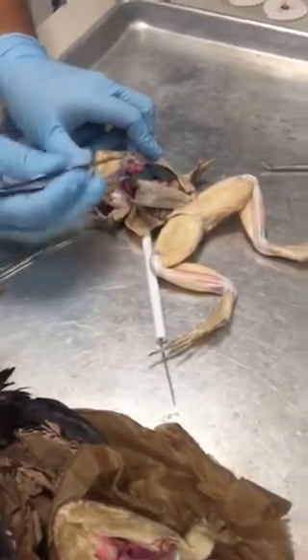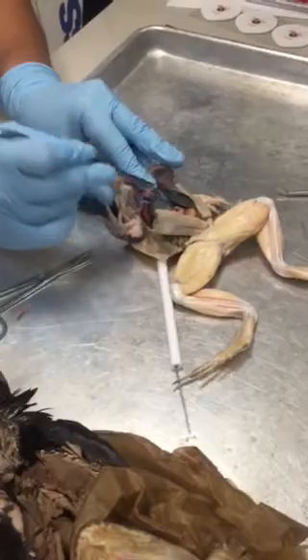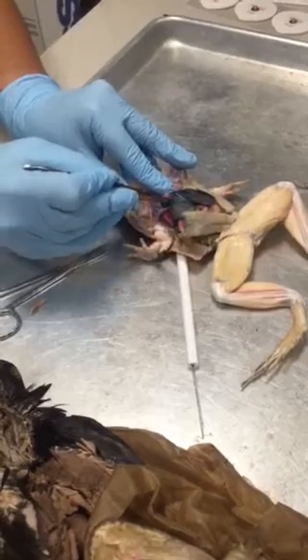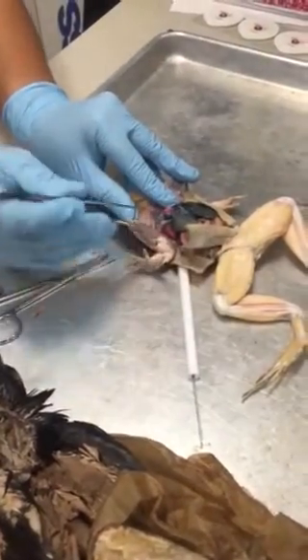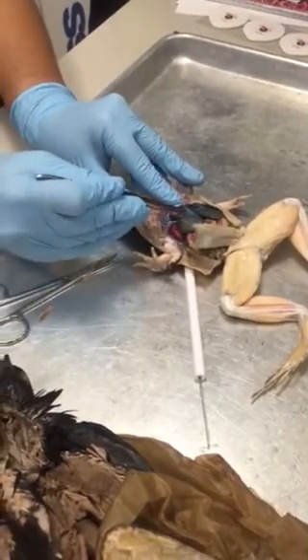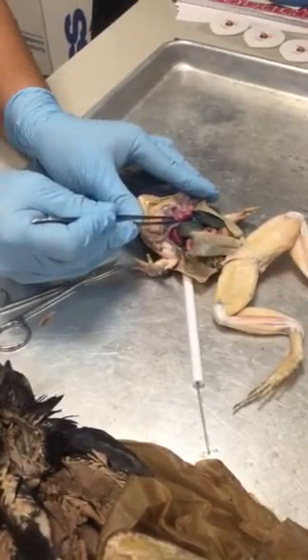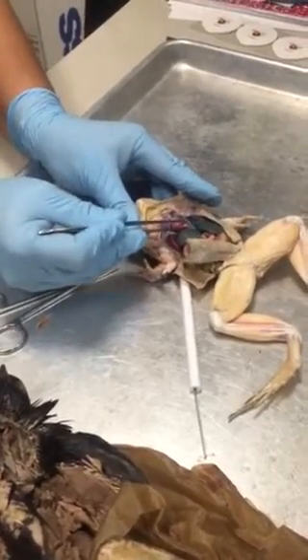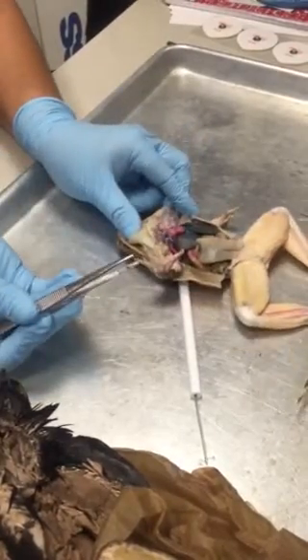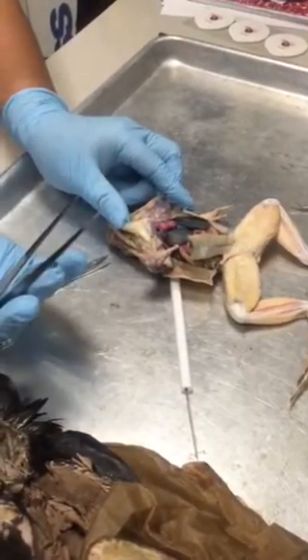So if we lift up the heart, you'll see that under the heart there's this big blue sinus or big blue vein that all the blood collects in, just like in the shark. Do you guys remember what that's called? Sinus venosus, okay? So from the sinus venosus, blood then travels into this first chamber here, the right atrium, and then it goes into the ventricle, and from the ventricle, it's pumped out into the system, okay? And that's kind of inefficient because that's straight up deoxygenated blood.